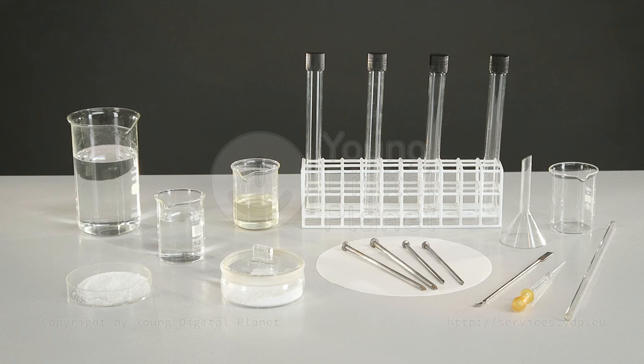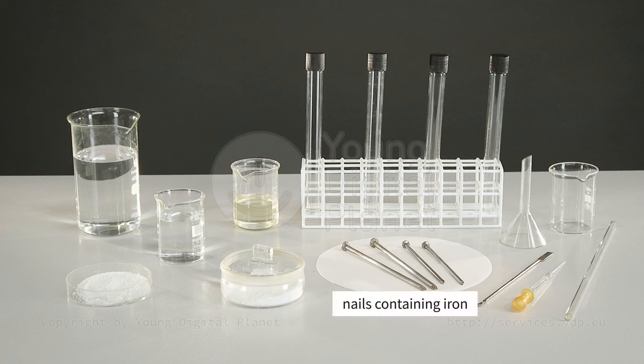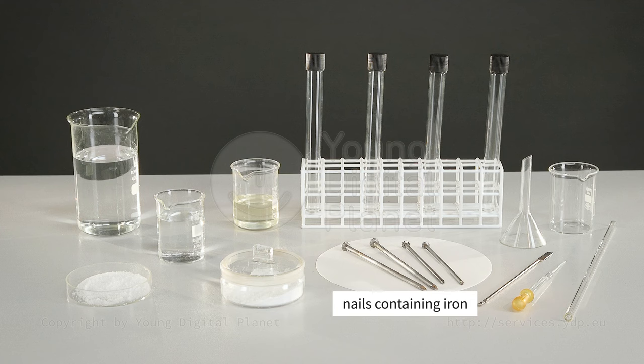Let us investigate the effect of external factors on rusting. We will need the following items for the experiment: nails containing iron.